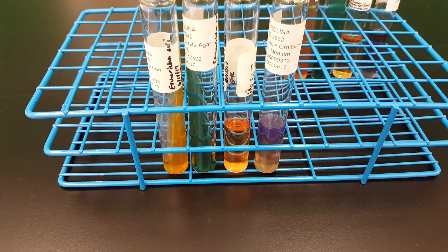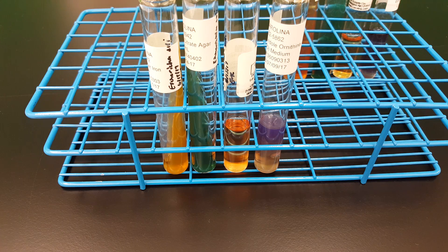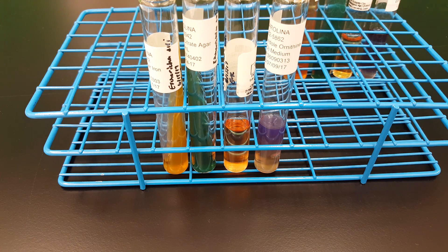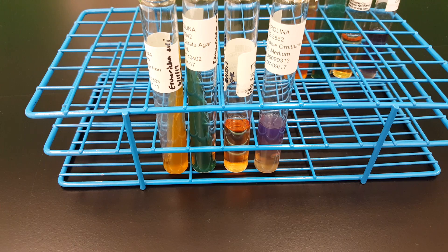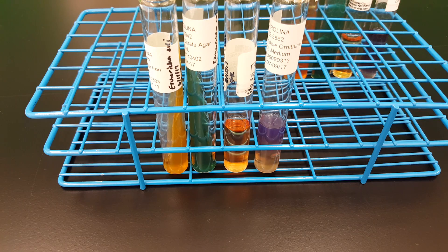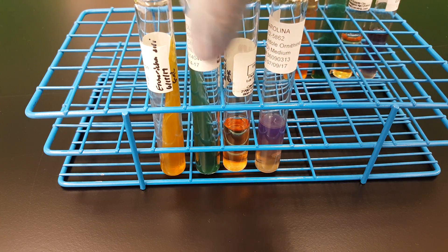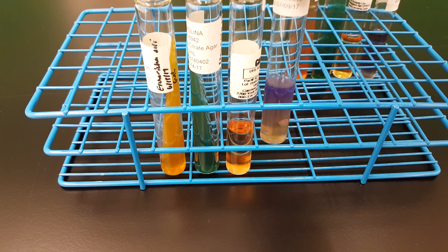Today we're going to be discussing the biochemical testing used to differentiate members of the gram-negative rod Enterobacteriaceae family. In front of me I have Escherichia coli, also known as E. coli. I have the tubes that I had inoculated previously: the TSI slant, the citrate slant, the urease broth, and the MIO tube.